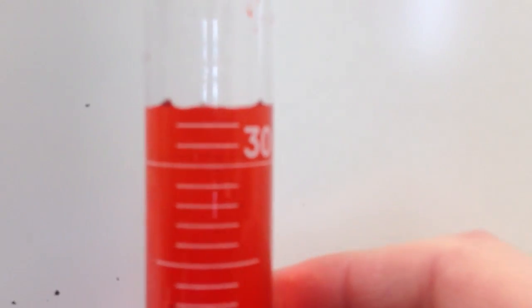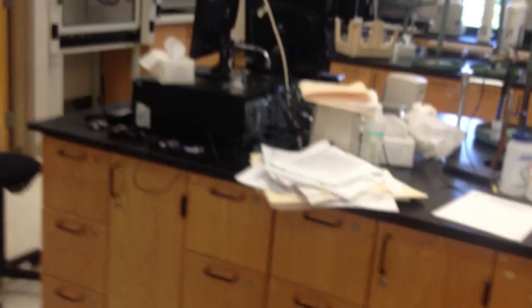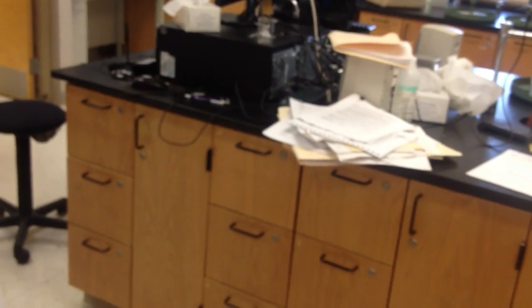We can estimate one more sig fig. I'm going to pour a little bit of water out here. Sorry about the condition of the lab. They're waxing, so they've got everything up there. What is it with me and perfect pouring? There it goes right on the meniscus again. There we go.